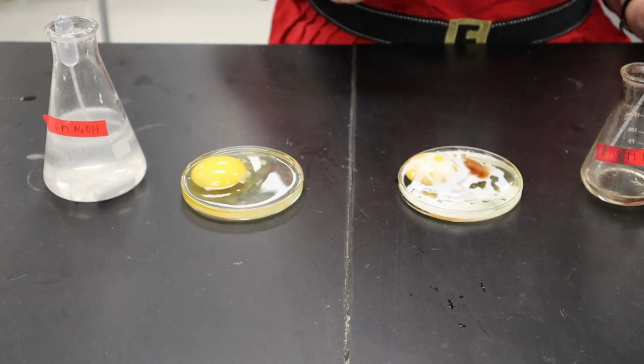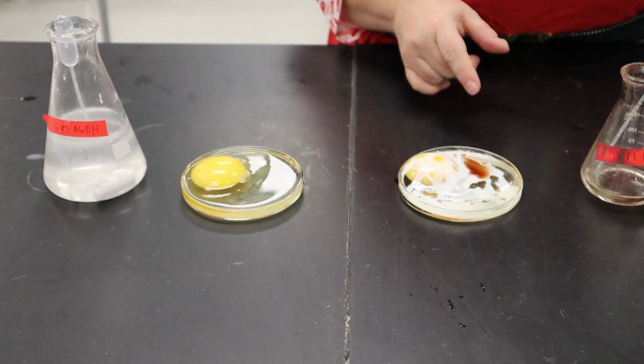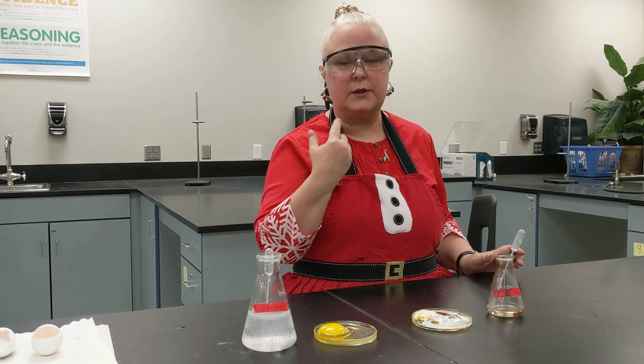You can see that this one is reacting even more so over here. This poor egg, it has been used up. If it was your eye, you would have no chance. You need to be really careful with your eyes, and you need to wear goggles.